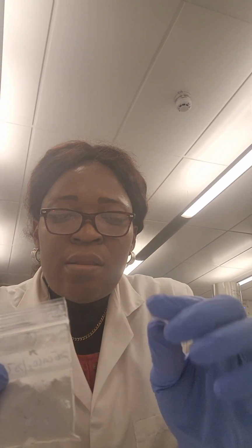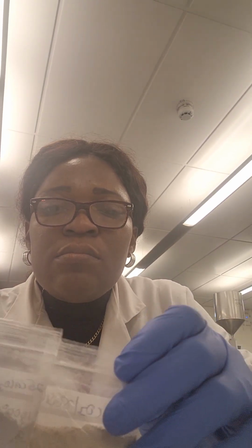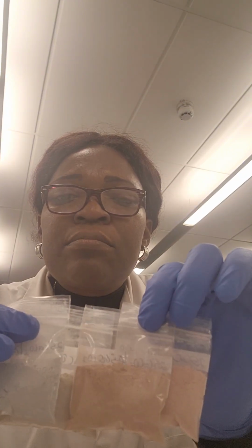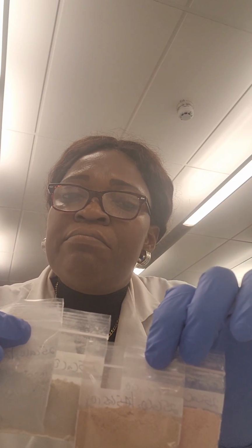And of course, we'll keep observing it till 1200 degrees Celsius. If you have anything you think would have caused that, having noted the composition and knowing a bit of chemistry, you could just share with us. That's really interesting. And so we are going after 1000. We see this for 800, 900, 1000. You should see a lot of transition in color.